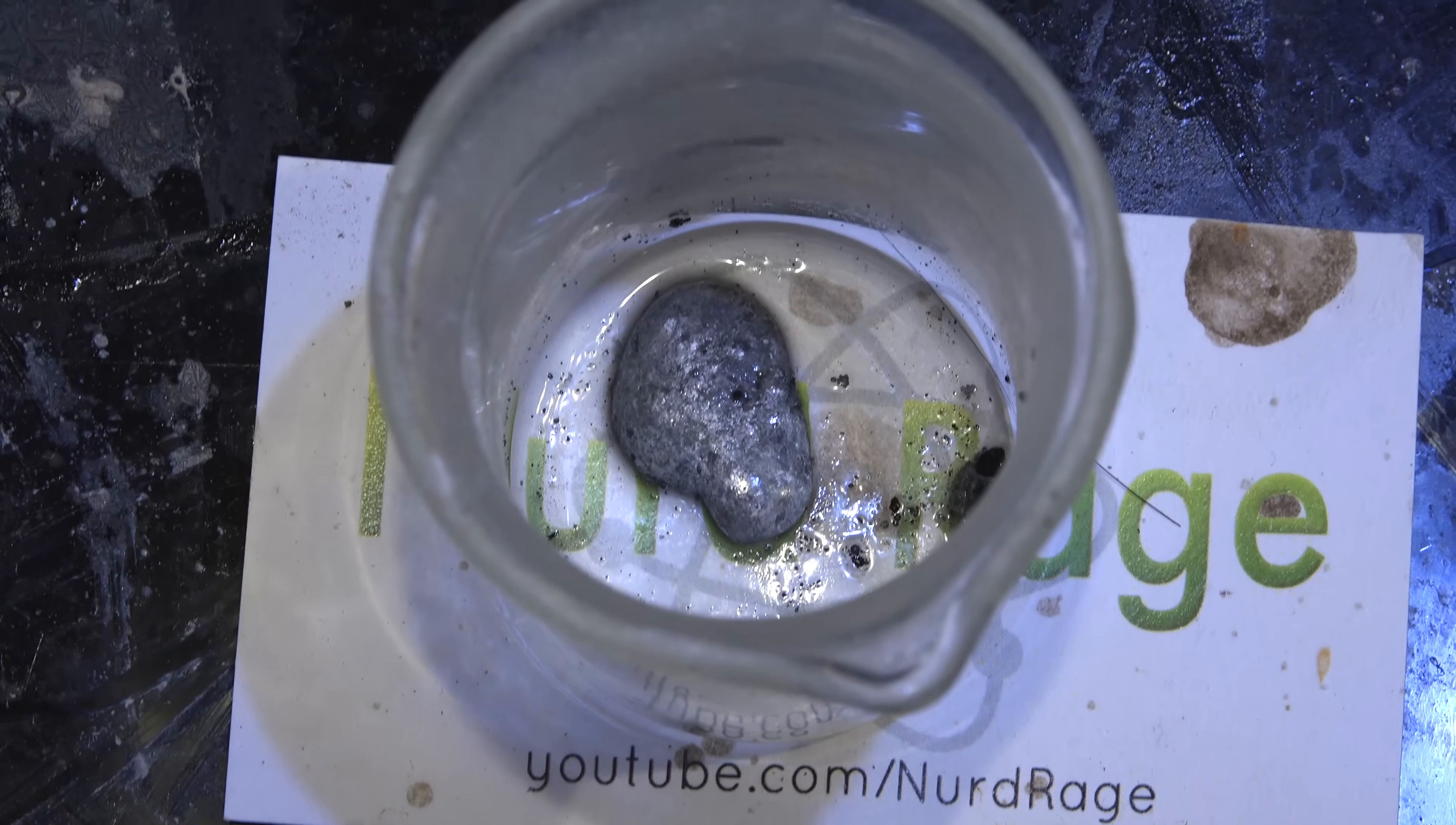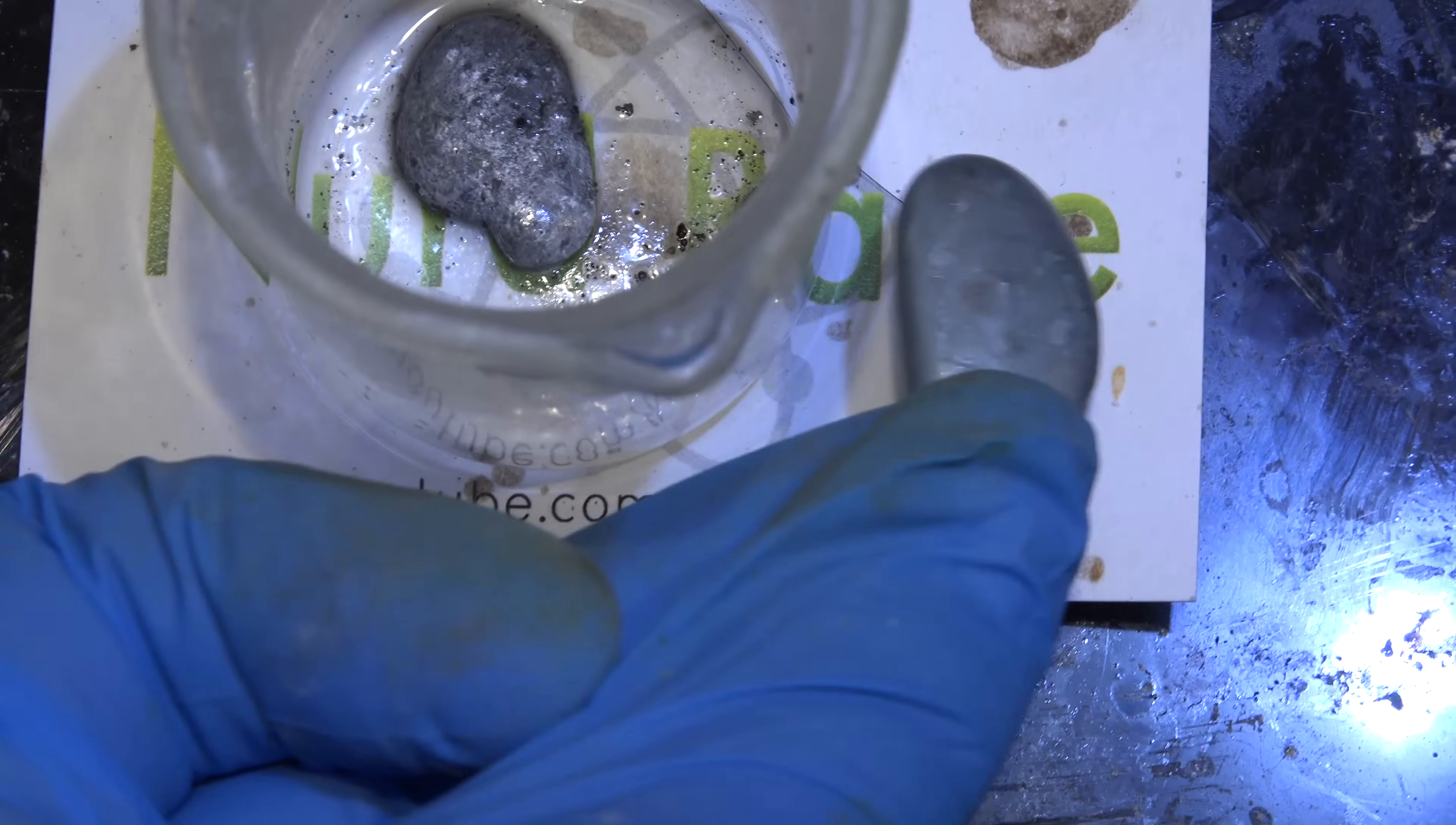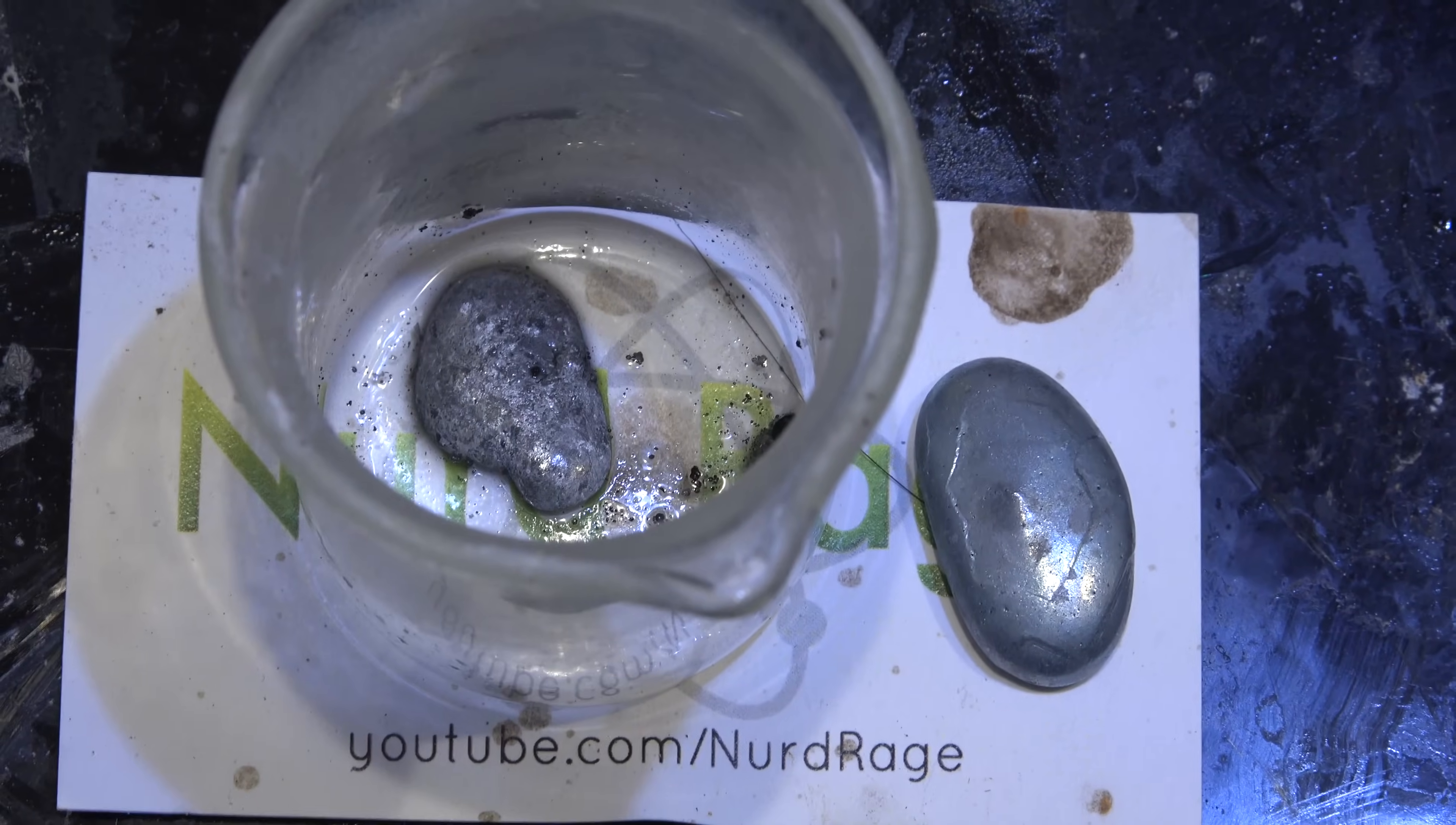If a failure gives results this good, imagine how much I would have gotten if I actually did this right. For comparison this is the same gallium nugget recovered by a simple reaction with sodium hydroxide. I think I would have gotten an equal amount if I hadn't screwed up.